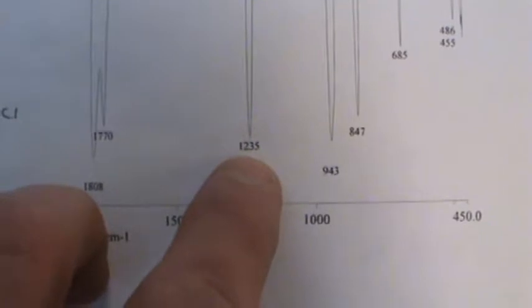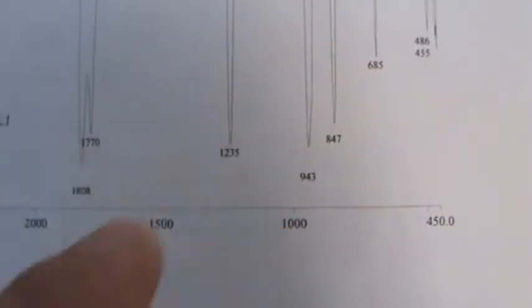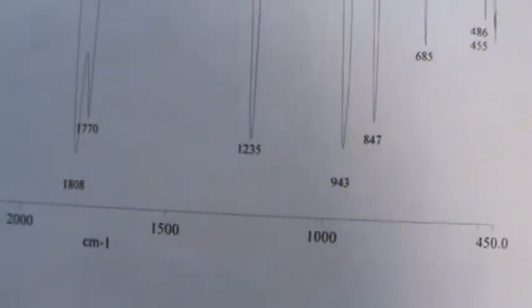Thionyl chloride by itself has a slightly different number than this, but sometimes compounds have a certain interaction with each other that you can get a little bit of variation on that. So that's one of the ways we could take a look at that.